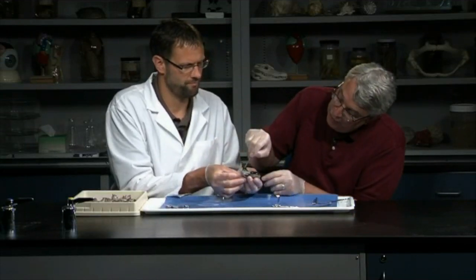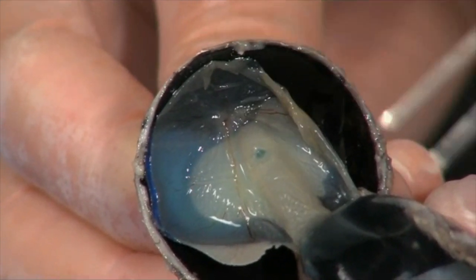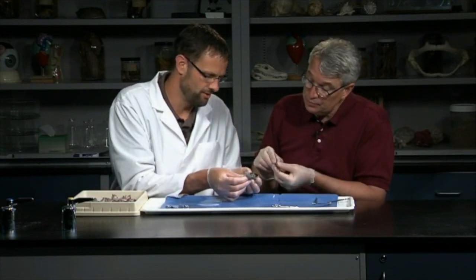Right where the optic nerve comes in, that's called the optic disc, and there are no photoreceptors there. So that's actually sometimes called the blind spot. And your brain kind of compensates for that. Only when you do special tests do you discover that there's this little spot where you don't have vision. All right, so go ahead and just kind of pull it here.